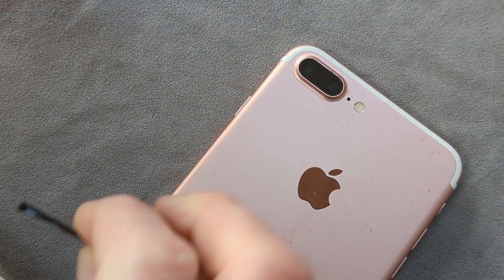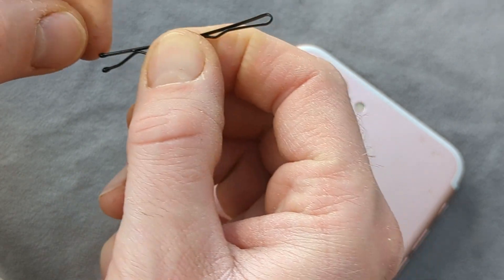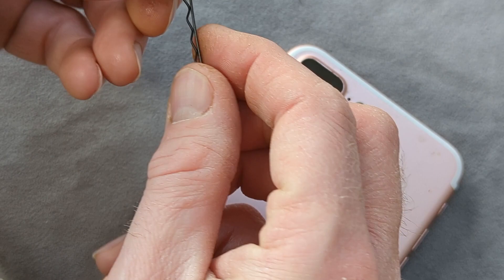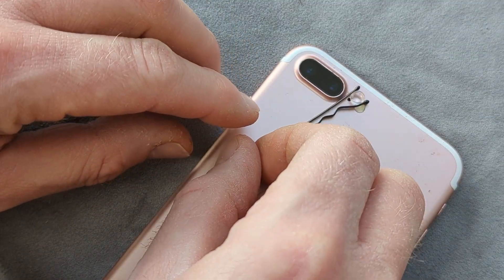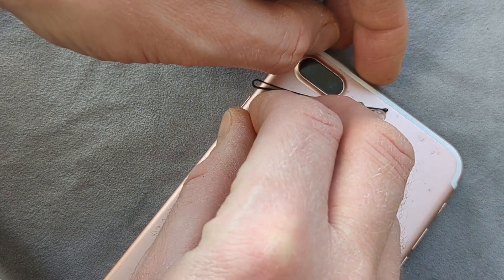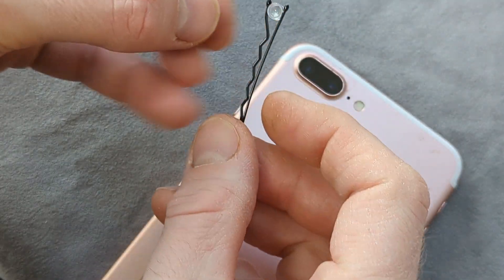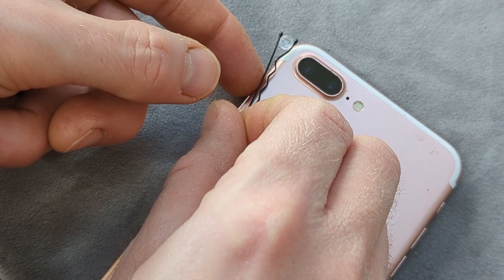I started to assemble it, and I don't think it's quite clear from those videos how fiddly this really is. You can see I ended up using a hair clip — I remember seeing this on another video a while back — because the lens is so small, you can kind of wedge it into the hair clip and put it exactly in the position you want on the back of the smartphone over the camera lens. But it's really fiddly.